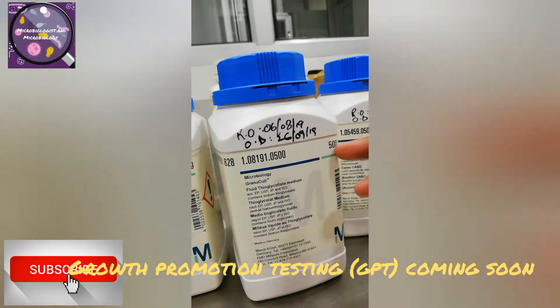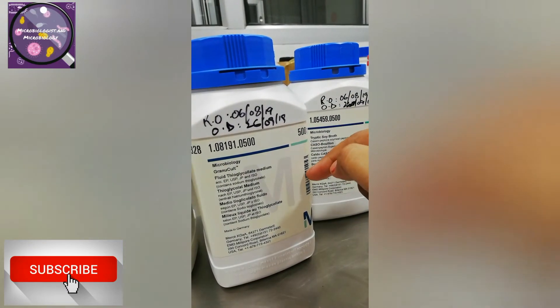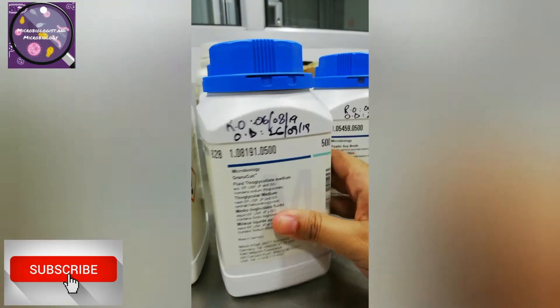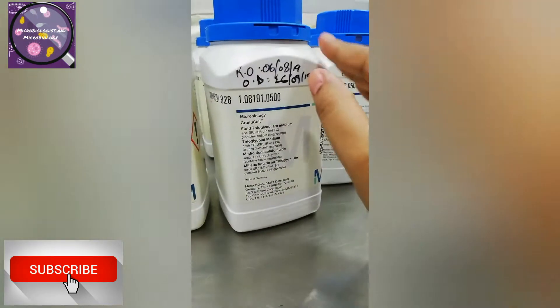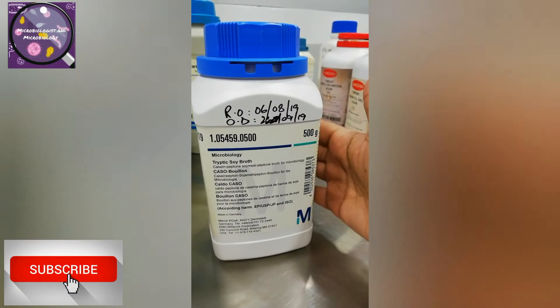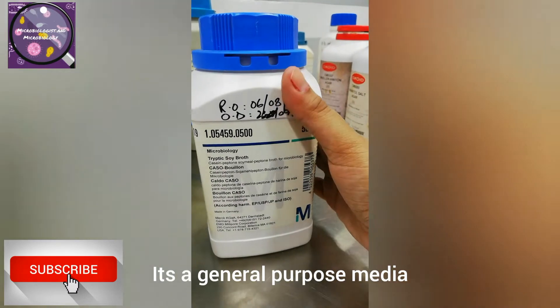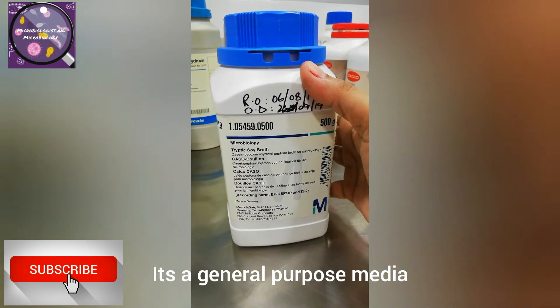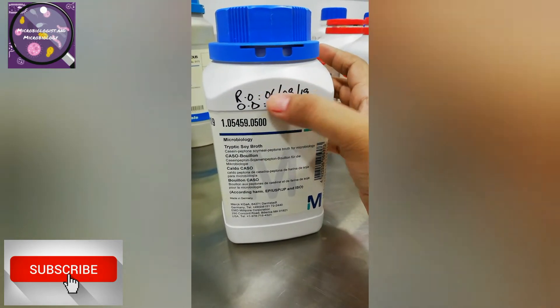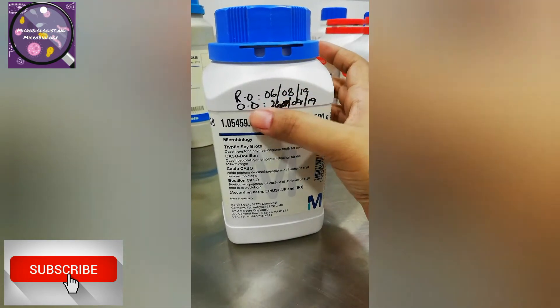I am also going to make a growth promotion test video where I will explain all the steps of growth promotion testing. I finish one bottle and then move to the next one. My next bottle is TSB — tryptic soya broth — which is also used in sterility testing and in other testing like bio burden, swab testing, and culture growth.